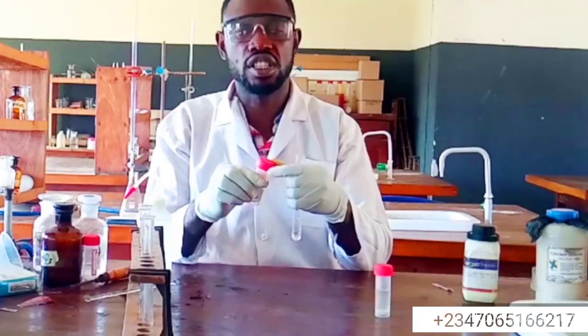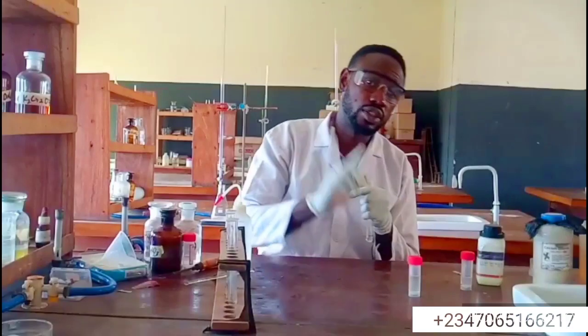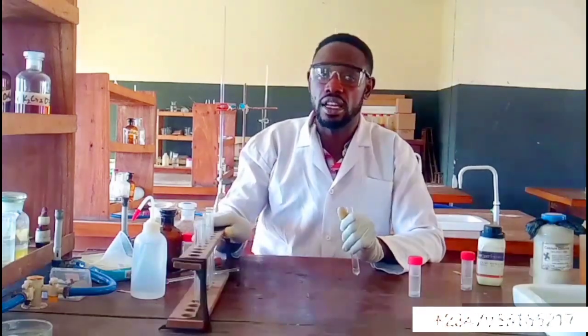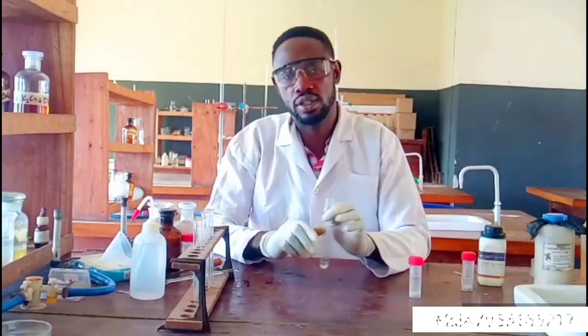that's lead nitrate. For detailed analysis on lead and lead nitrate, watch my video here on test for lead 2 ion. The video here on this channel has the details on how you can test for lead 2 ions, and what I used in that video is actually lead 2 nitrate.